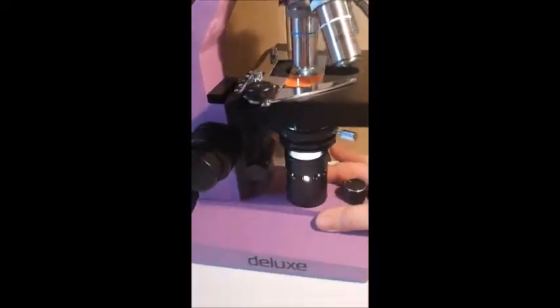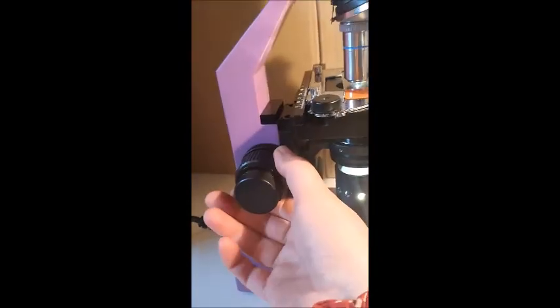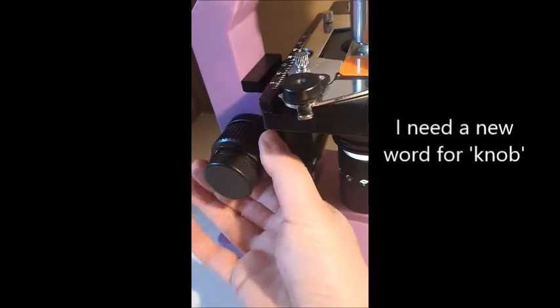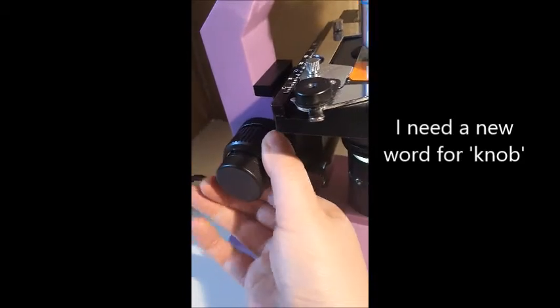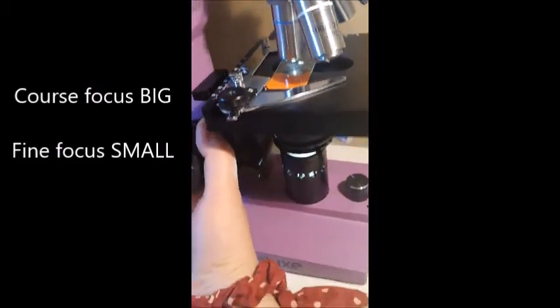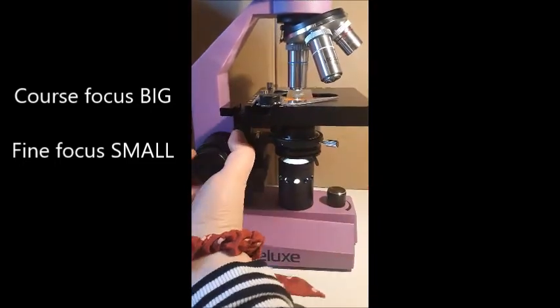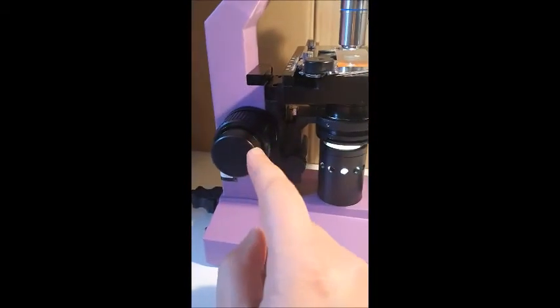All right. Now, what else have we got? We've got this big knob here, and it's actually got 2 knobs on it. You can turn these bits separately. So the large part is the coarse focus, which actually moves the stage up and down. See that? And then the smaller part is the fine focus, which is still moving the stage up and down, but only at a much smaller rate.